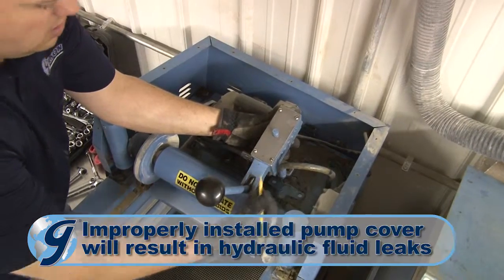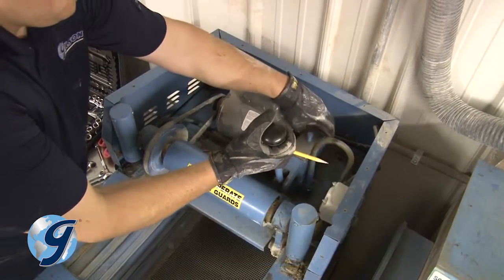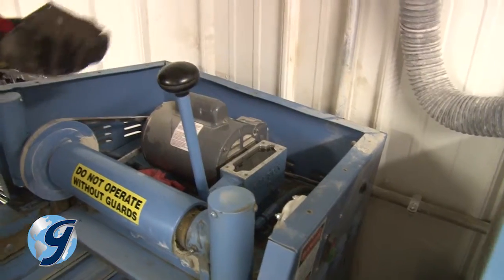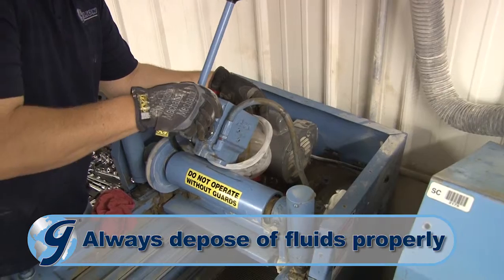Mark the pump cover and pump so when it's reinstalled later, it will face in the same manner. Now, remove the pump cover and set it aside. Lift the pump out and drain the hydraulic fluid into a container for proper disposal.